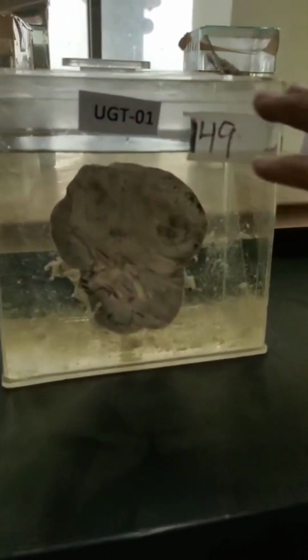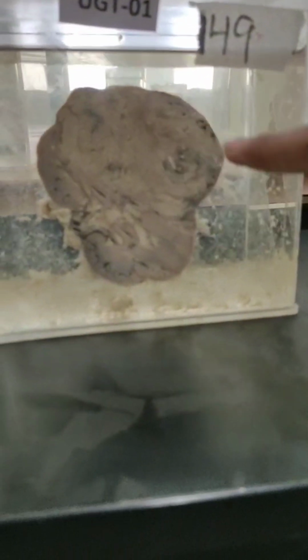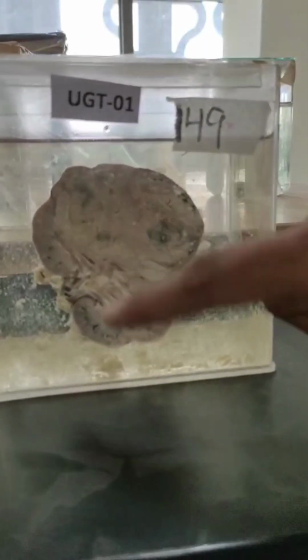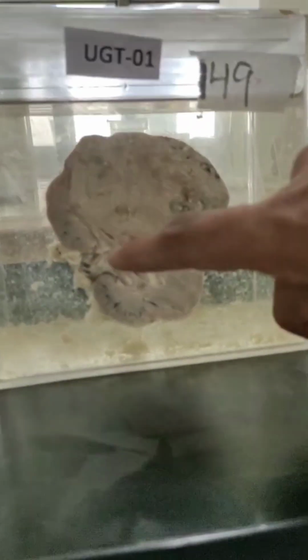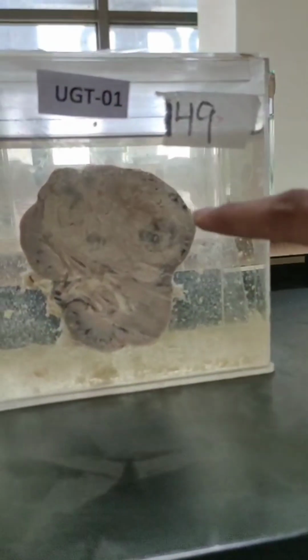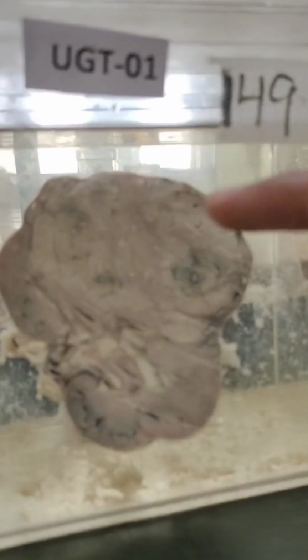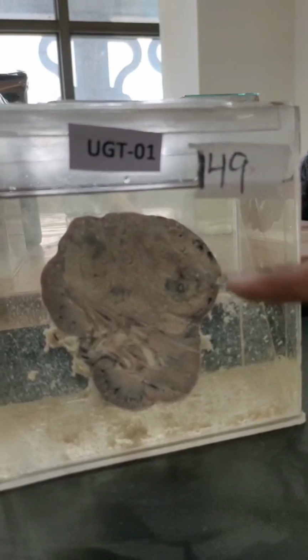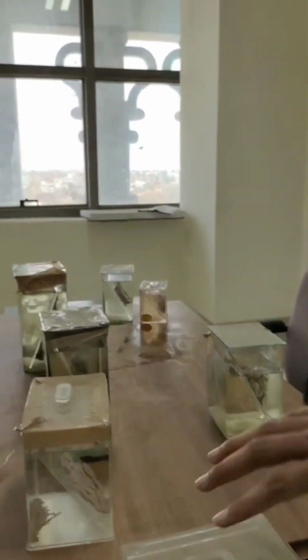So this is a glass jar containing a specimen. Here you can see renal, some kind of a renal thing. Here you can see the renal calyx, pelvis, and on the upper part you can see some pathology is there, and this can be most probably a kidney with renal cell carcinoma on the upper side. Okay, so this is the first specimen.